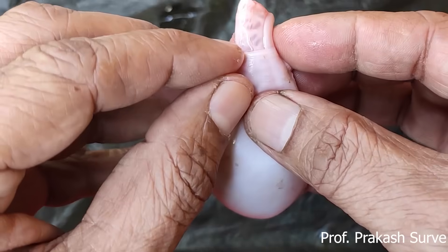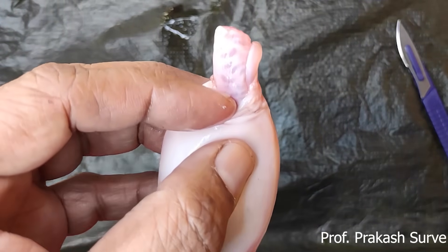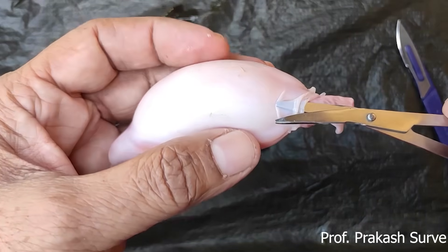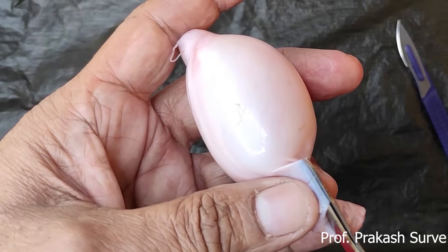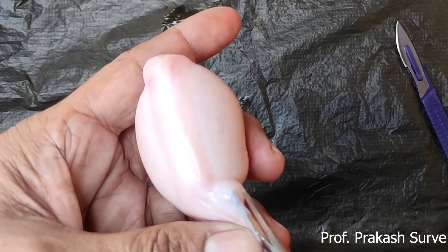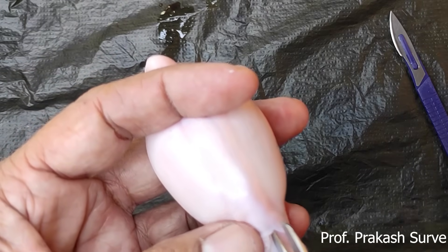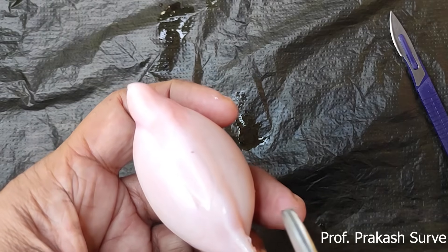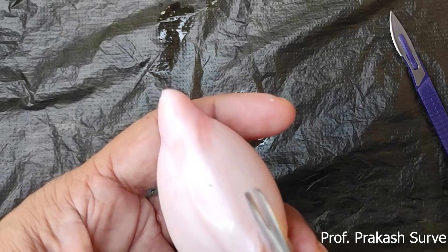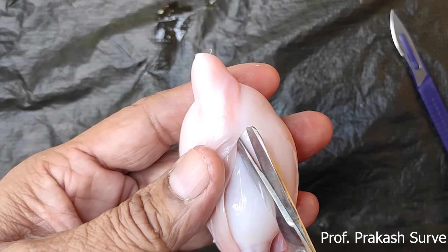I will try to remove this tunica albuginea. It is a thin layer. Carefully I will cut this. Once we remove this tunica albuginea, inner to that the tunica vasculosa is there. Slowly, first I will remove the tunica albuginea. Carefully we have to cut this.